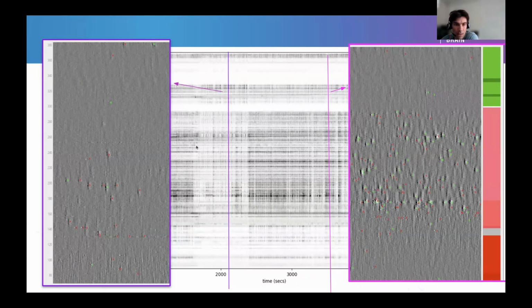We can see that indeed, the spiking activity on the left is way less than it is on the right. So whatever this is, it may be due to behavior, it may be due to brain state, it may be due to many things, but it's not due to the raw data quality or to a spike sorting failure. In this case, both are operating quite well. And so here the raw data is indicative of what's going on.